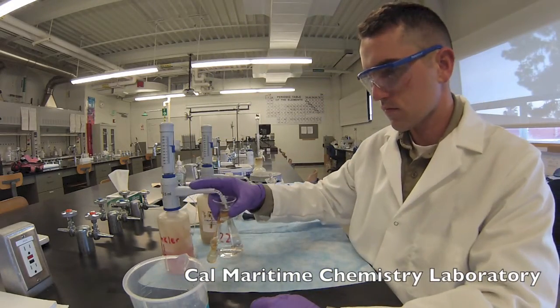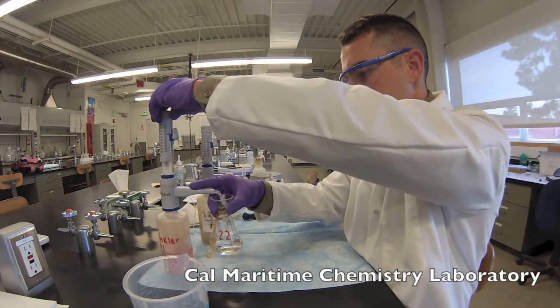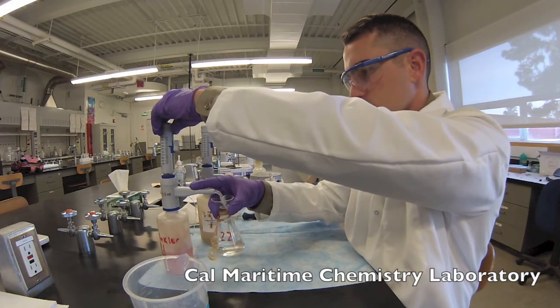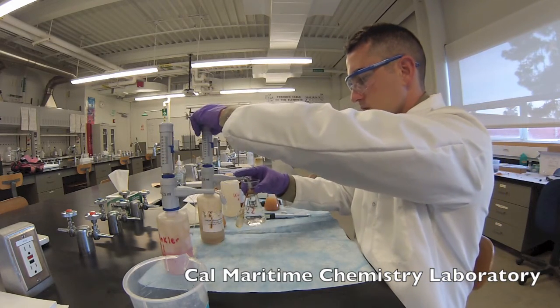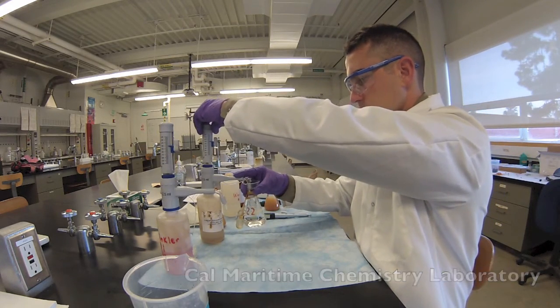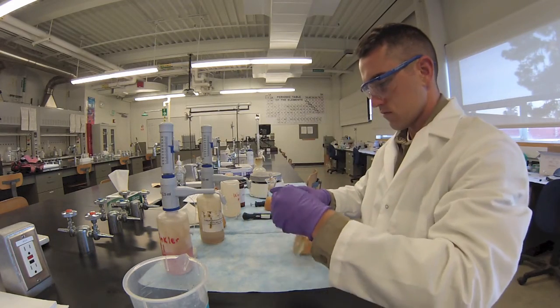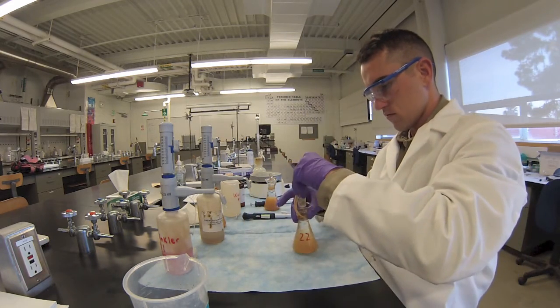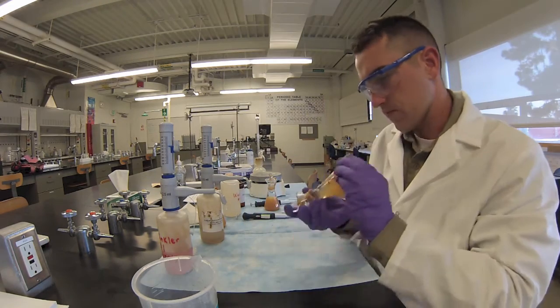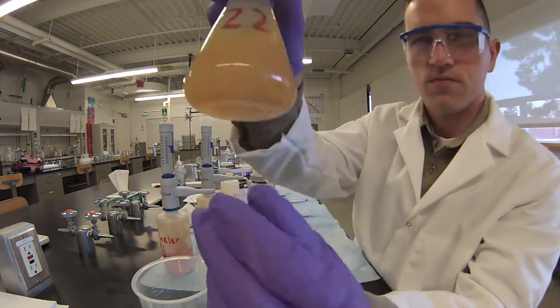Fixing the sample is important because without fixing, phytoplankton, bacteria, and other organisms in the water can quickly change the oxygen content through photosynthesis and respiration. Here is an example of the fixing process done in the lab so the reaction can be seen more clearly.